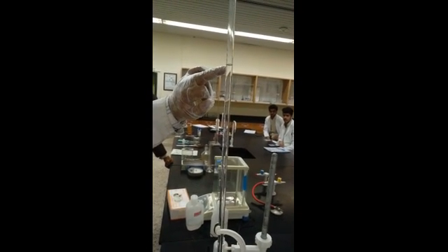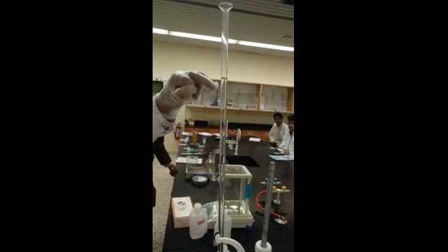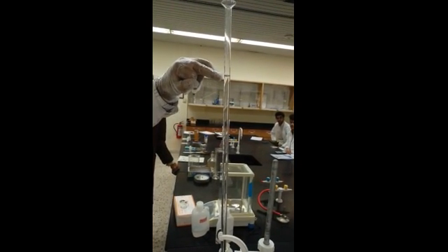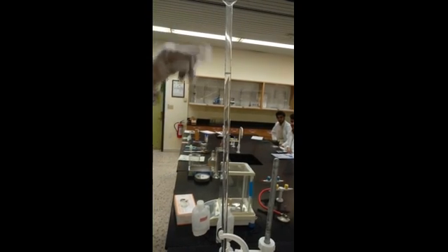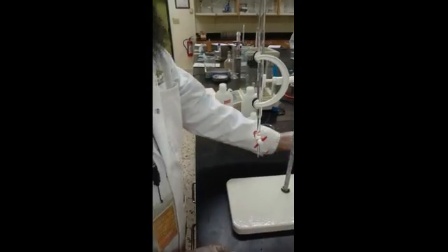Where do we start? We started from 0. Now we have ended up to the reading 7, and it is 7.5, 7.6, around 7.6. Right. Now what I will do is I have done my first titration. Then I will go back again.